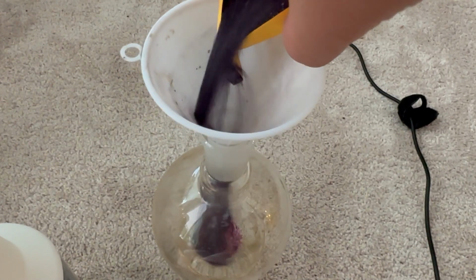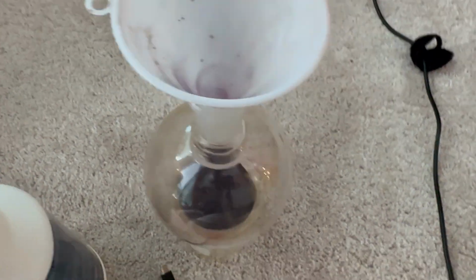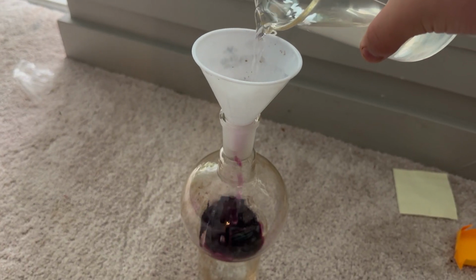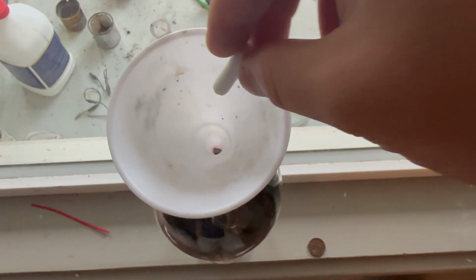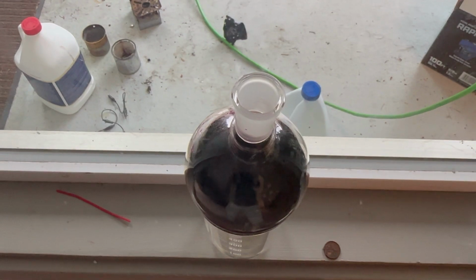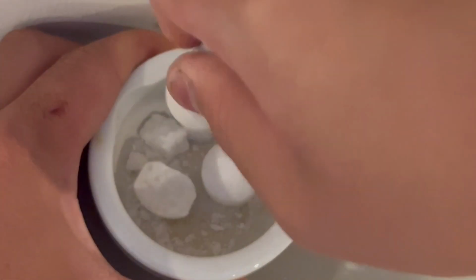First, I weigh out 40 grams of 80% potassium permanganate and add it along with 200 milliliters of 30% acetic acid. It's not advised to use a lower concentration. Now I add in a stir bar, and instead of being barbaric with a metal rod, I pound my mothballs in a civilized manner with a mortar and pestle.